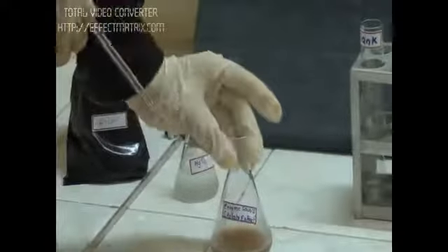Now we have to add the enzyme. We have to add 0.5 ml of enzyme to the test. Right now, we will not add it to the blank so that the reaction could take place only in our test solution. I am taking 0.5 ml of my enzyme to the test tube.